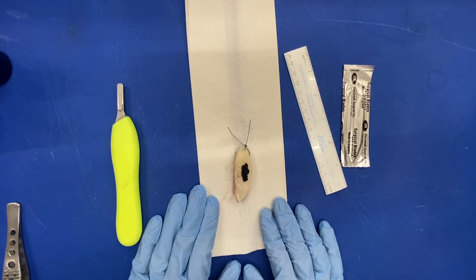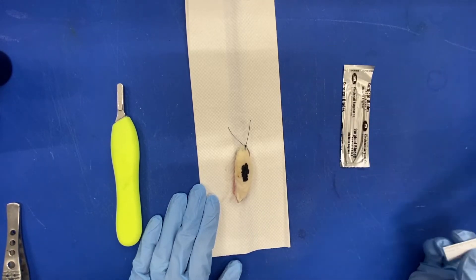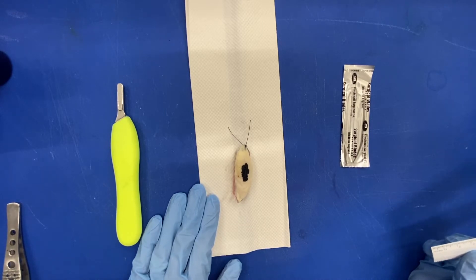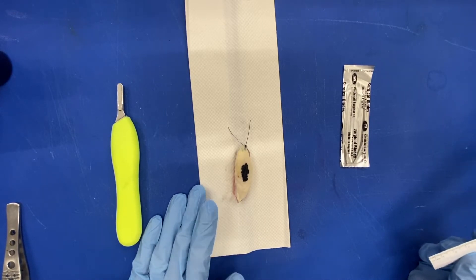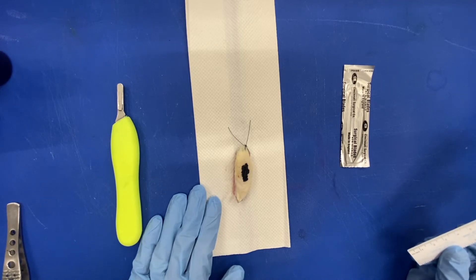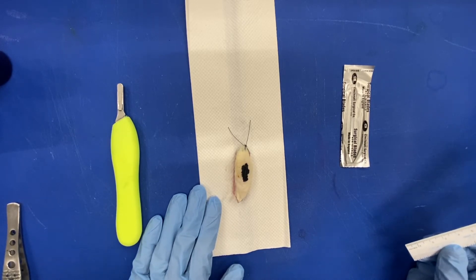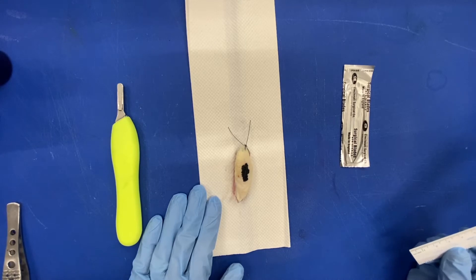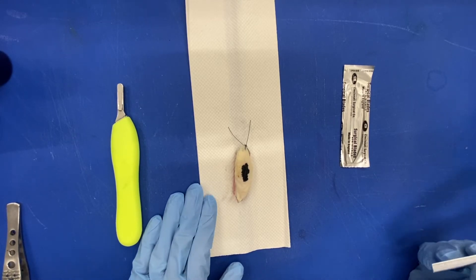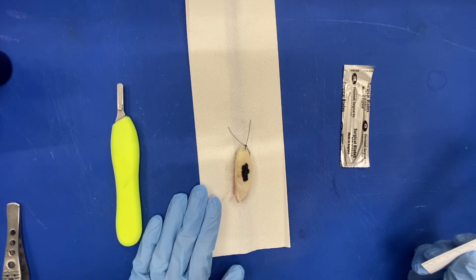So the first thing I will do is check that requisition, make sure everything makes sense, and then I will measure my specimen in three dimensions. In this case you measure the length and width of the skin ellipse and then the depth as well. I will go ahead and do those steps in a dictation format.